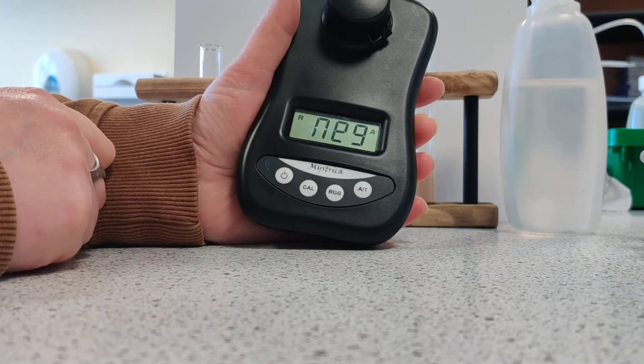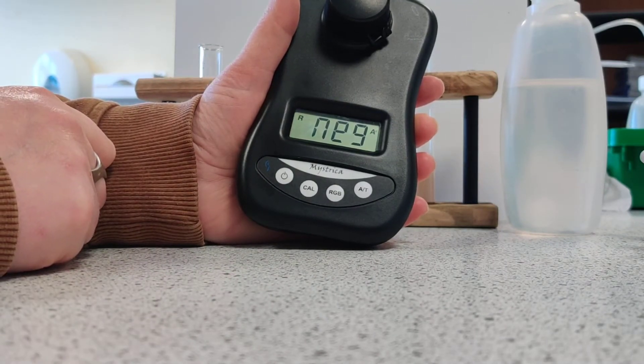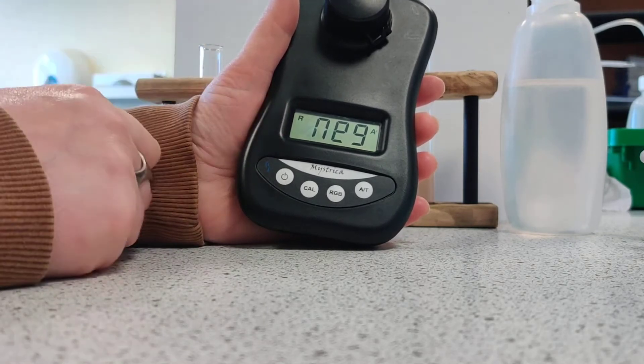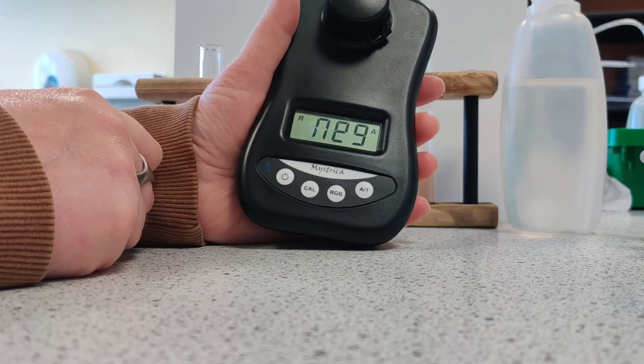The reading is currently negative because there's nothing in it. We have to calibrate the colourimeter using the distilled water and then work upwards, starting with the most dilute through to the most concentrated, and record the reading — how much light is absorbed for each sample. We record them in a table and compare that to the actual sample from Mr Lord's glass.